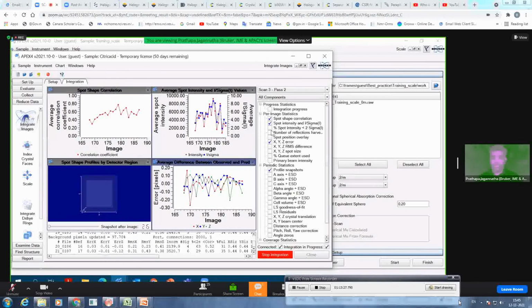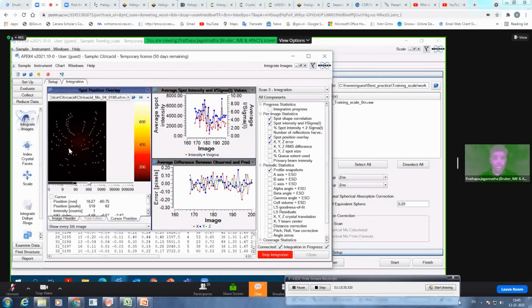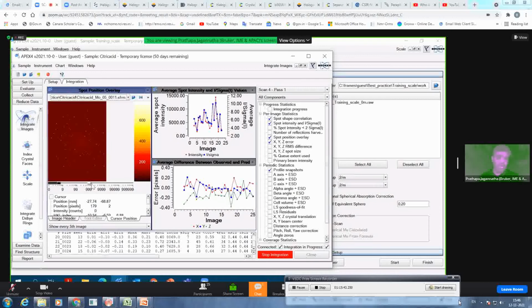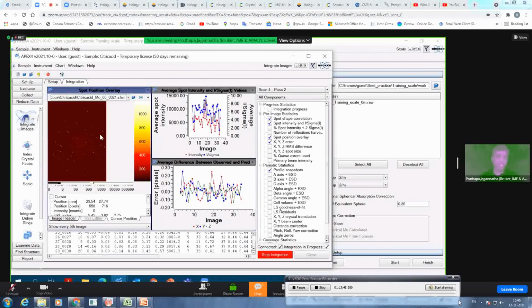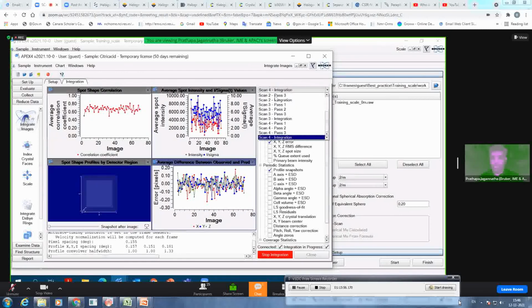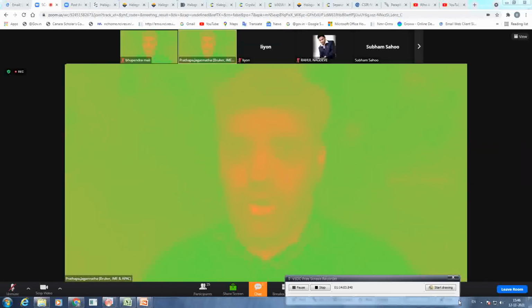And then there is also one more graph which I like, the spot position overlay. So you can constantly see how the integration is going on each frame, whether it takes care of all the reflections, or whether it is integrating in the wrong areas and not picking up the reflections. This also gives you live feedback of your integration process. All the time during integration, you can see there are some initial passes it is doing, which means optimizing the parameters, and then it starts the integration. Okay, let this run.